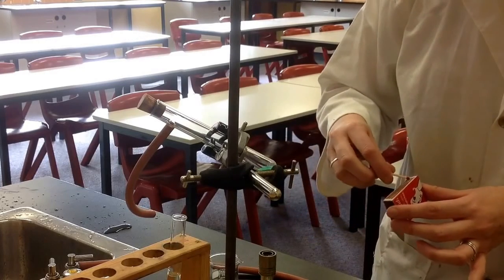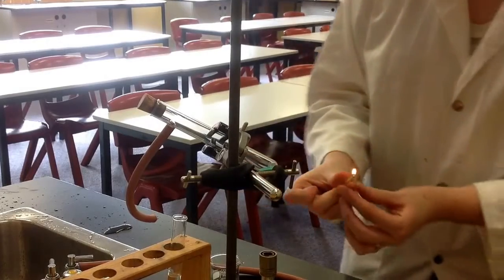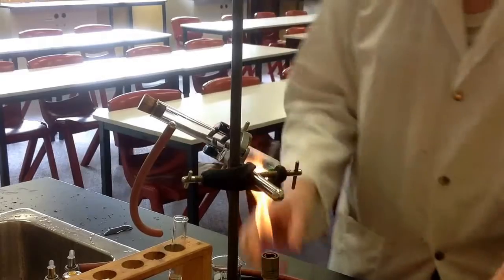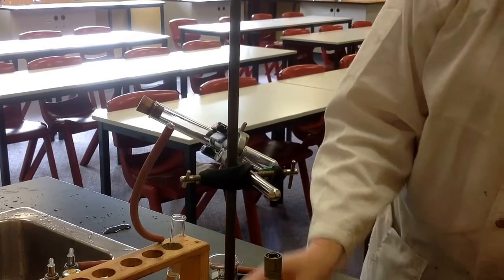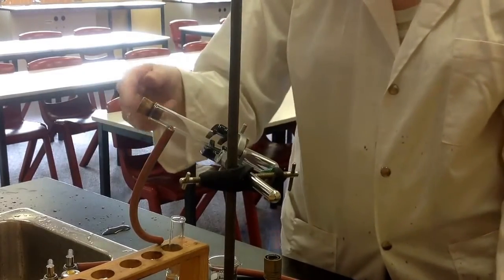So to start with, we light our Bunsen burner. Copper carbonate is a chemical that can be decomposed using heat. So we turn it to the blue flame. You can see I've actually got it pointing away from me because by no means do I want this shooting out and hitting me.